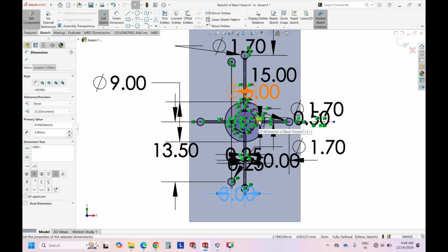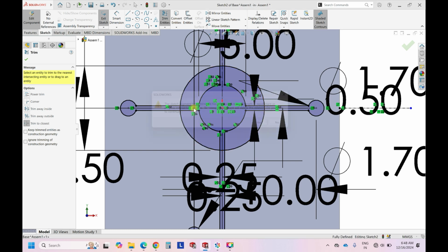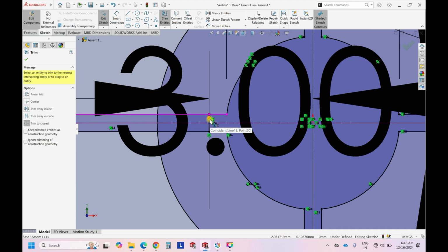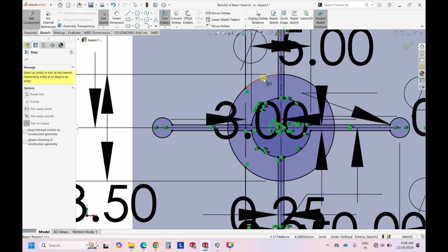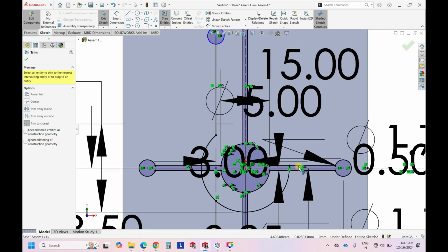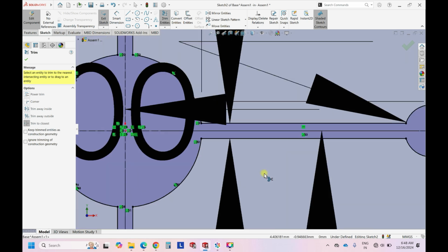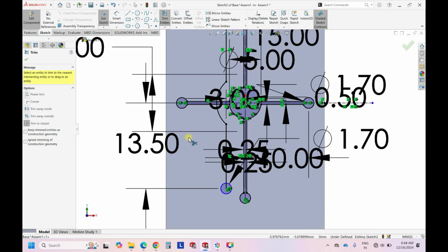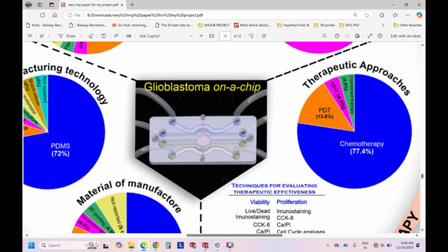Okay, so the next thing we do is use the trim entities option over here. We don't want this line internal, we don't want this, and also we don't want this too, right? And then we don't want this, similar to this. Okay, so we just want the shape of this. Yeah, perfect.